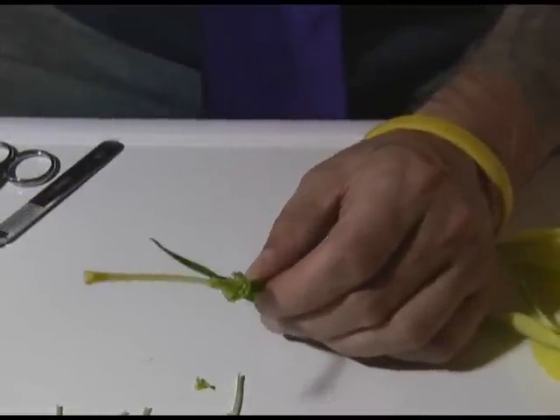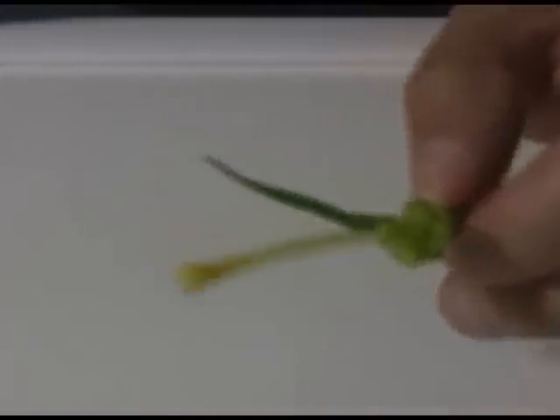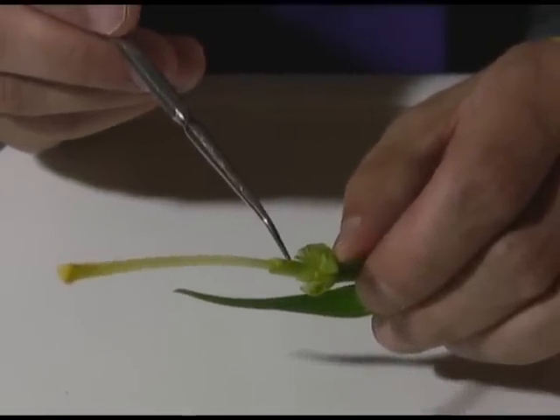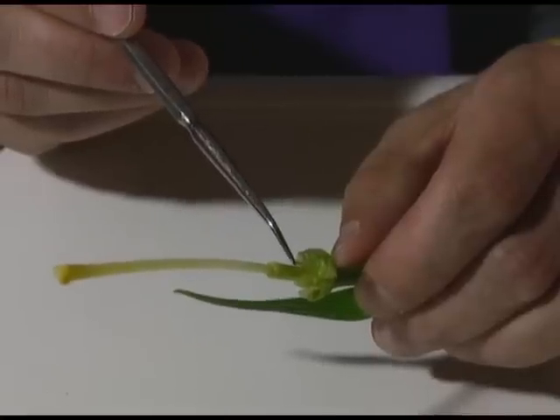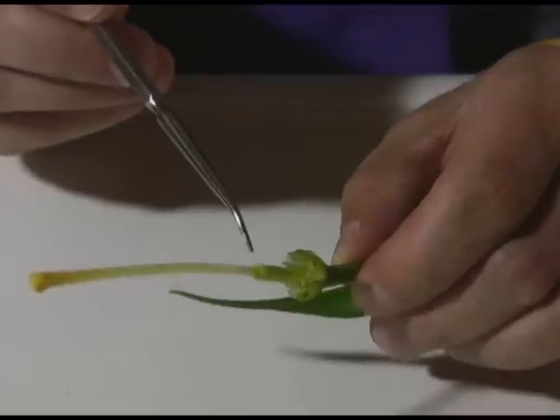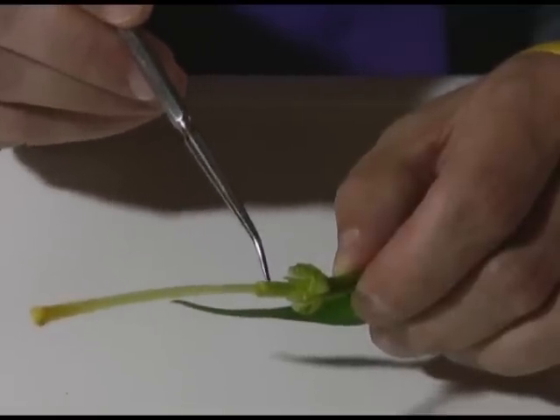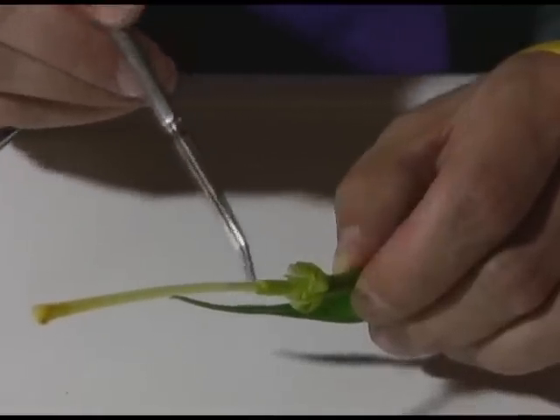Now here's the thing we want to examine a little bit more closely. This is the female part. Right down here — see this green thing? That is part of the ovary, and inside there we would expect to find the eggs, which when fertilized become the seeds. Here's an interesting fact: if you've ever eaten an apple, a pear, a peach, a banana — all those things are formed from flowers, and the apple or whatever fruit you're talking about is actually an ovary. As the flower of the apple gets fertilized, the eggs become seeds, and then the fleshy part of the apple forms from an ovary. So when you eat an apple, it's actually a big swollen, ripened ovary.